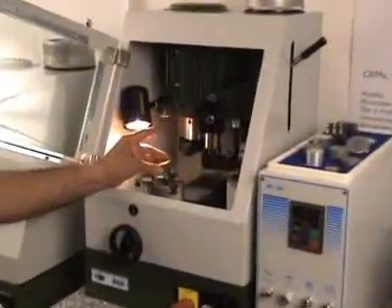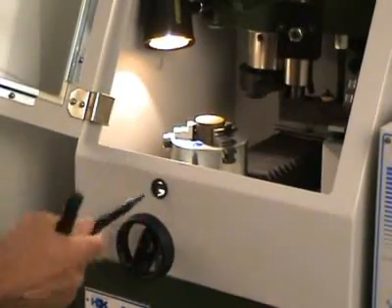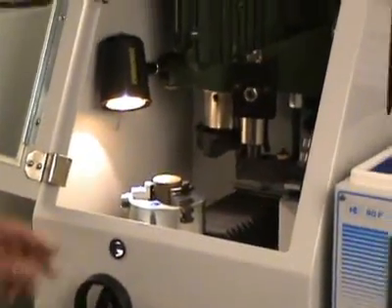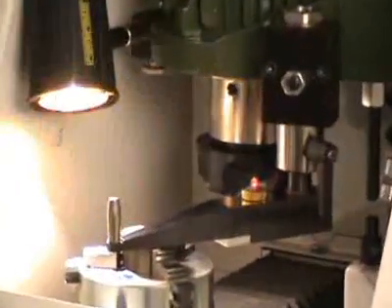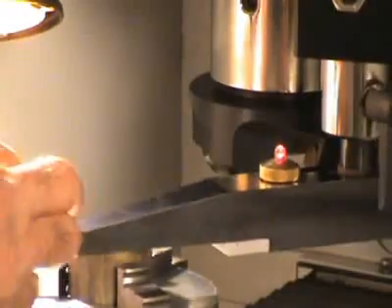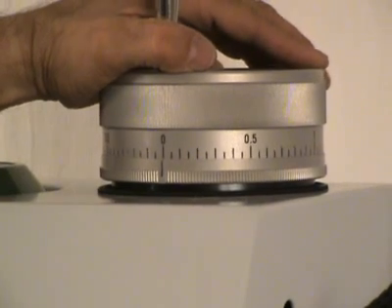The sample is fixed in the chuck. Now the sample height is measured and the level is indicated by a red LED. The cutting depth is set one tenth of a millimeter between two long markings.